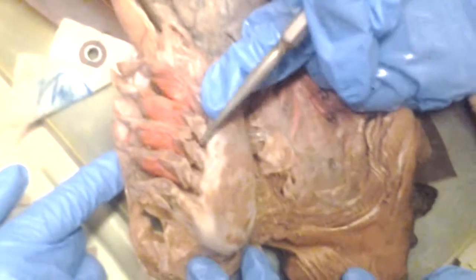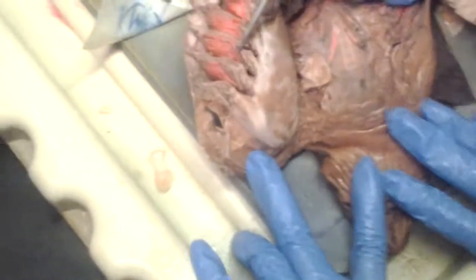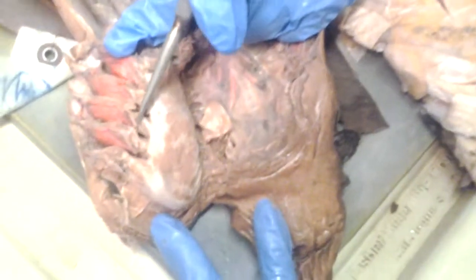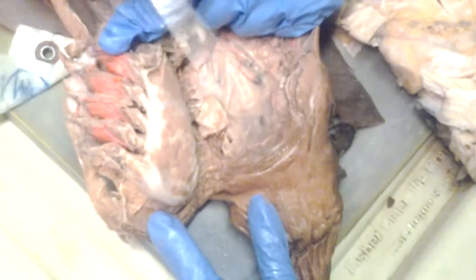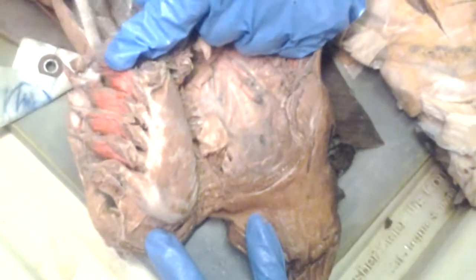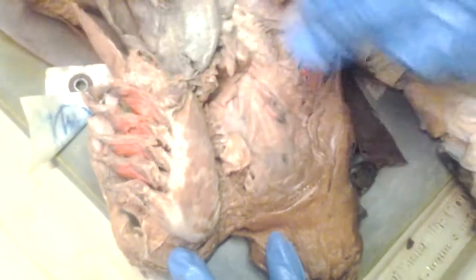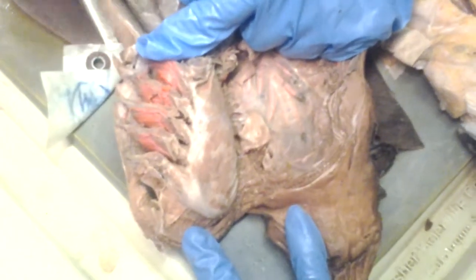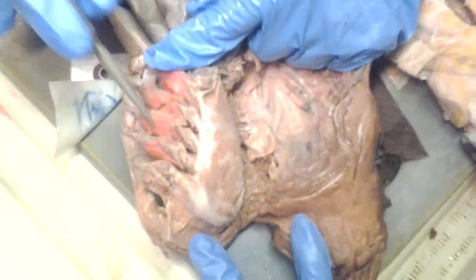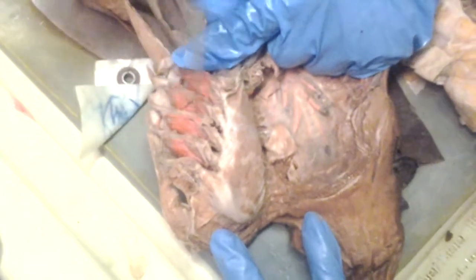Good question. Gill rays. So it has gill rakers and gill rays. There are two projections on the gill arch cartilages. The rakers cover up the opening of the gill pouches internally to prevent the food from getting into the gills. The gill rays support the gills. They branch out to the gills and support the gill. On a skeleton you can see them, but you can't see them here.